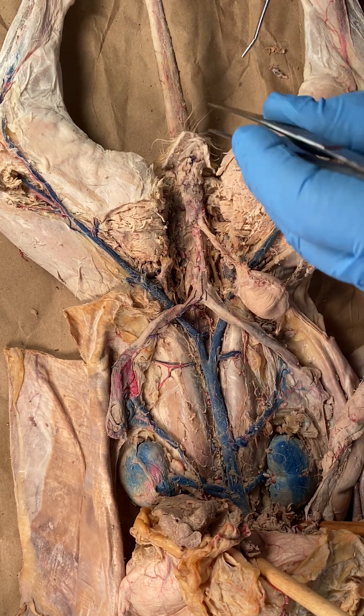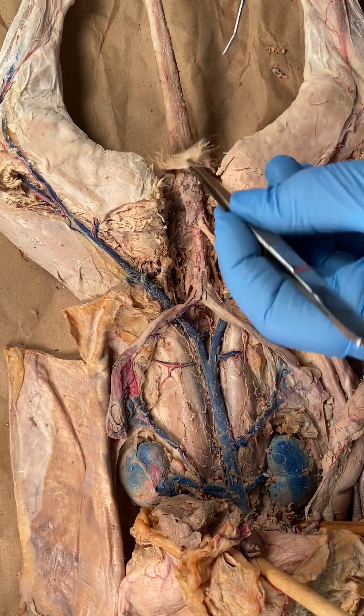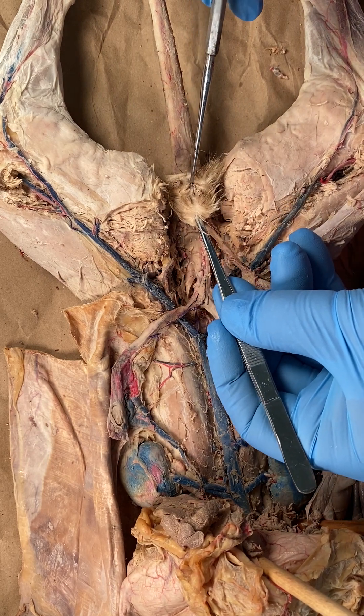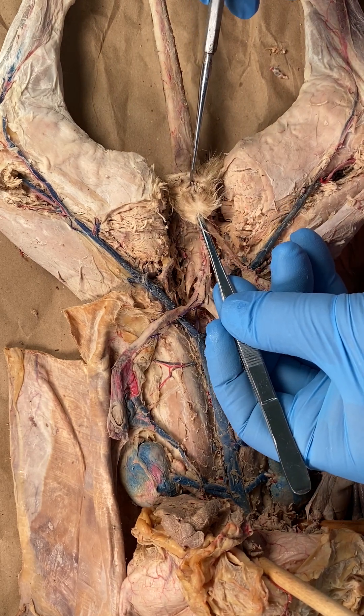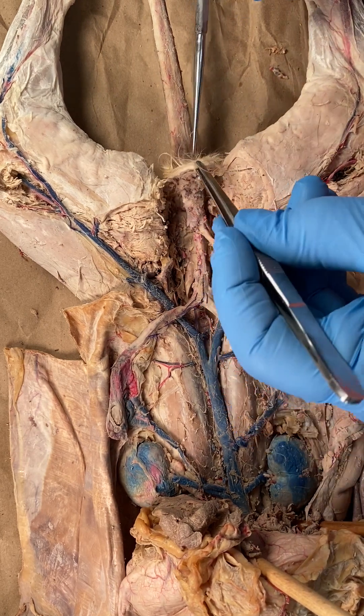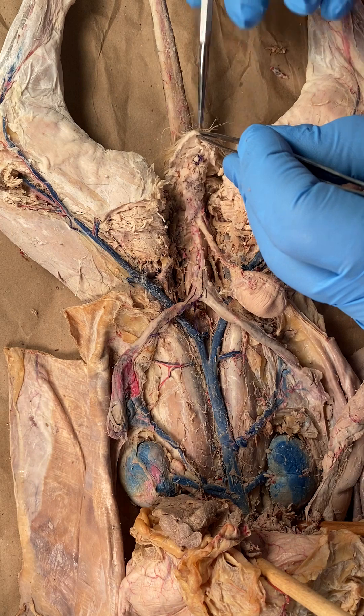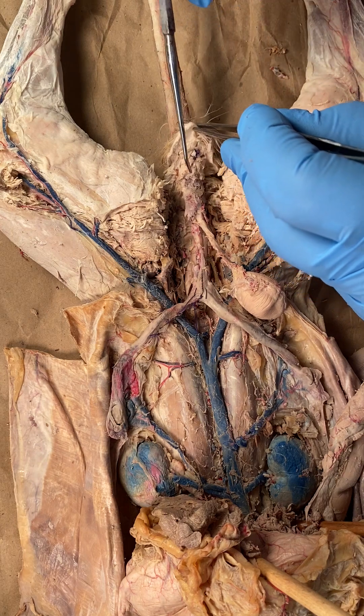Here is the opening of the vagina. If I pull this up this way, you can see the opening of the vagina, and you can see that leads to the inside of the urogenital sinus.